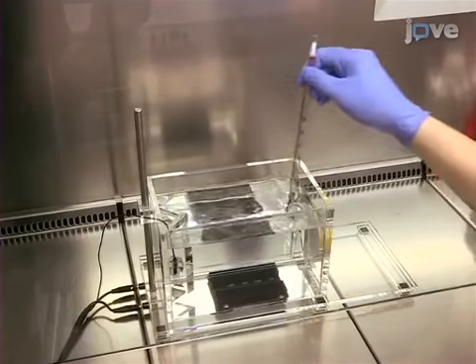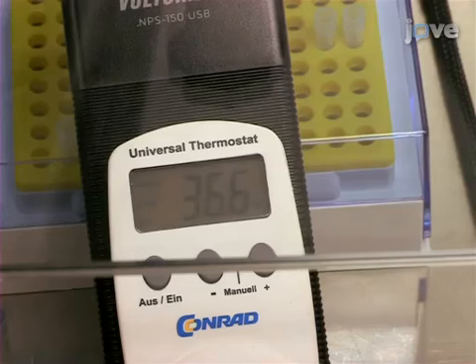Then, while stirring the water continuously, connect the heater to a power supply and heat the water to a stable temperature of 37 degrees Celsius.